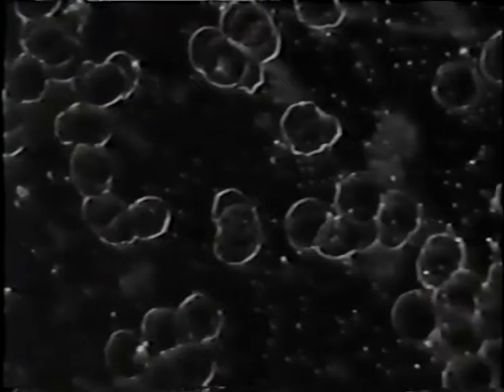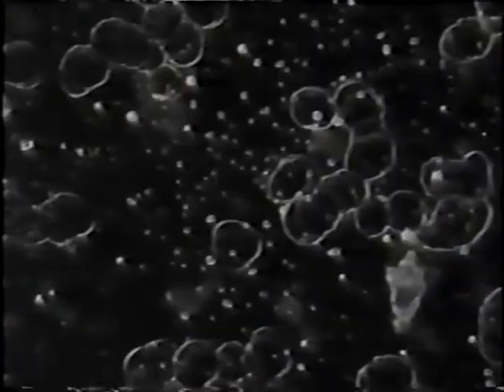Now this is after the first exposure, approximately 24 hours afterwards. See, there's a little bit of particulate matter in the background. The blood cells tend to unclump slightly. They're still all quite damaged looking, the blood cells, but you can see all the particulate matter that's been released by the use of the device. There's also some cellular debris here and there.